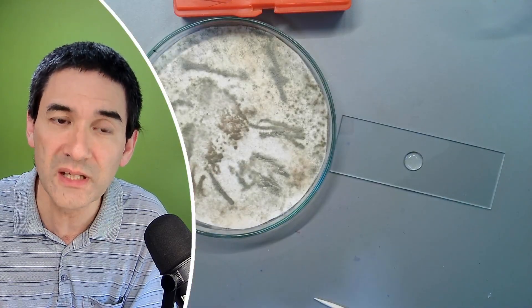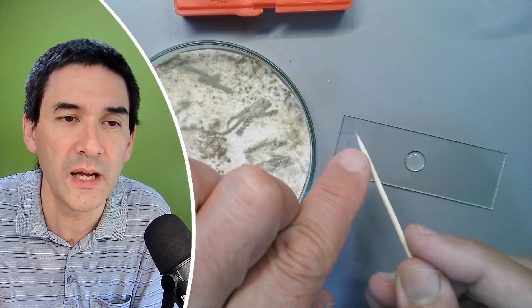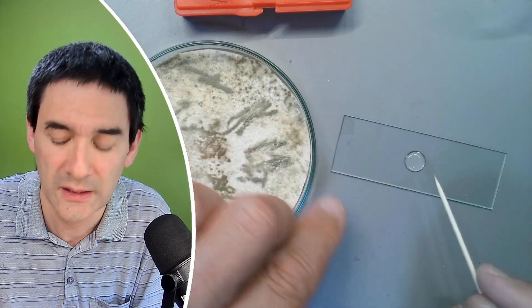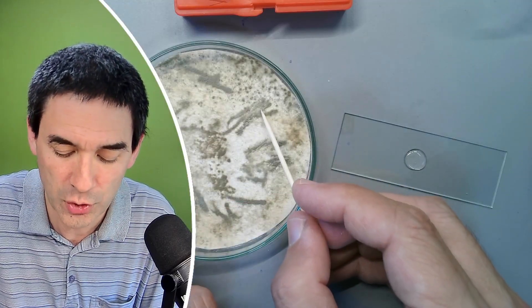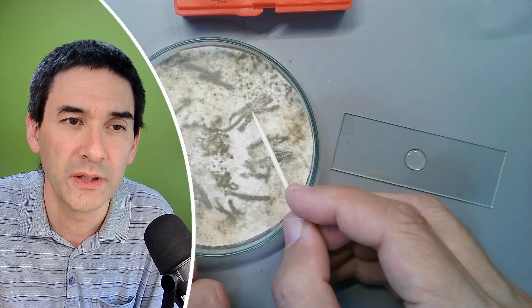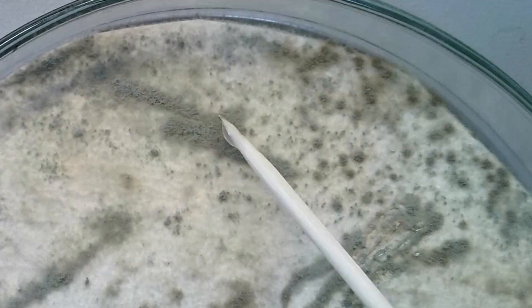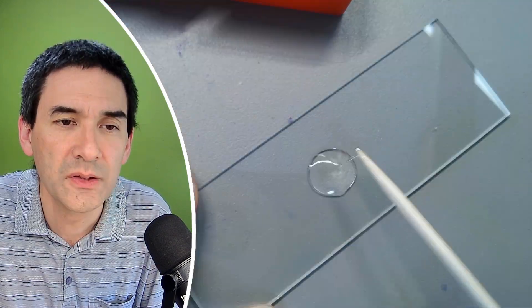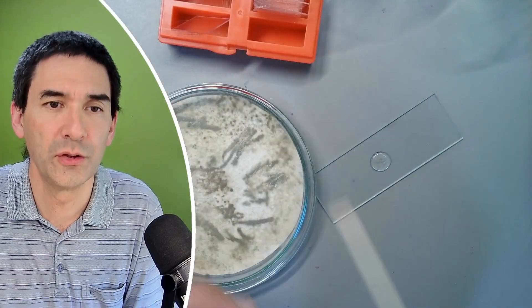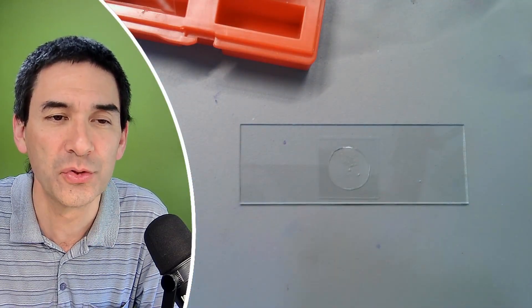I'm going to pick up a couple of these spores and mix them well with the mounting medium, with the glue. So maybe we take something from here — and yes, there is something on here. You see it's kind of dark gray-green. We can simply mix it in here, and this will also break apart any clusters. Now that there is some glue already on here, it might be actually much easier to pick up more of these spores. You don't need a lot. So let's carefully roll it in here to pick up more. I think that is definitely more than enough. I want to immediately close the lid again. This goes into the trash, and a cover glass goes on top, and then you allow capillary action to do the rest. See how the glue starts to spread — we just ignore those air bubbles in here. Then we just wait a few days for it to dry.